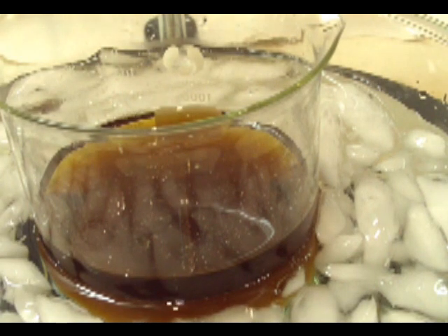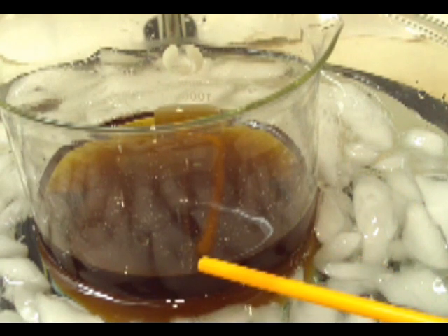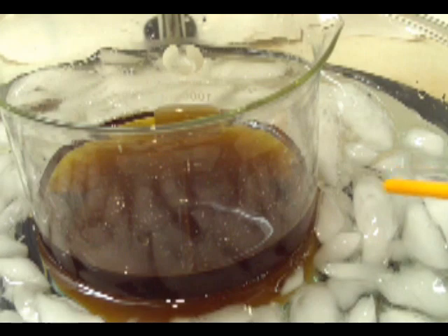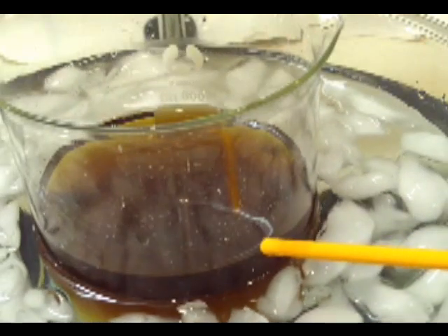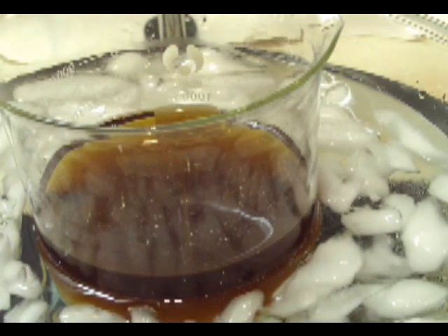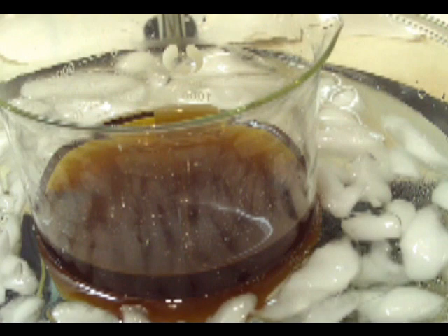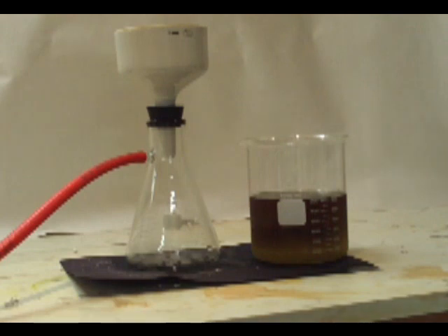As the procedure moves ahead you're going to get more and more of it. When it's done, the contaminants give it an ugly brown color. I've got it in an ice bath right now to try to get as much of the potassium bisulfate to come out of solution and crash out. Now we want to move on to filtering it once you feel everything's out. Set up your vacuum filtration — you don't have to use vacuum filtration, you're welcome to gravity filter this, it will obviously take a little longer, but I chose to do vacuum.